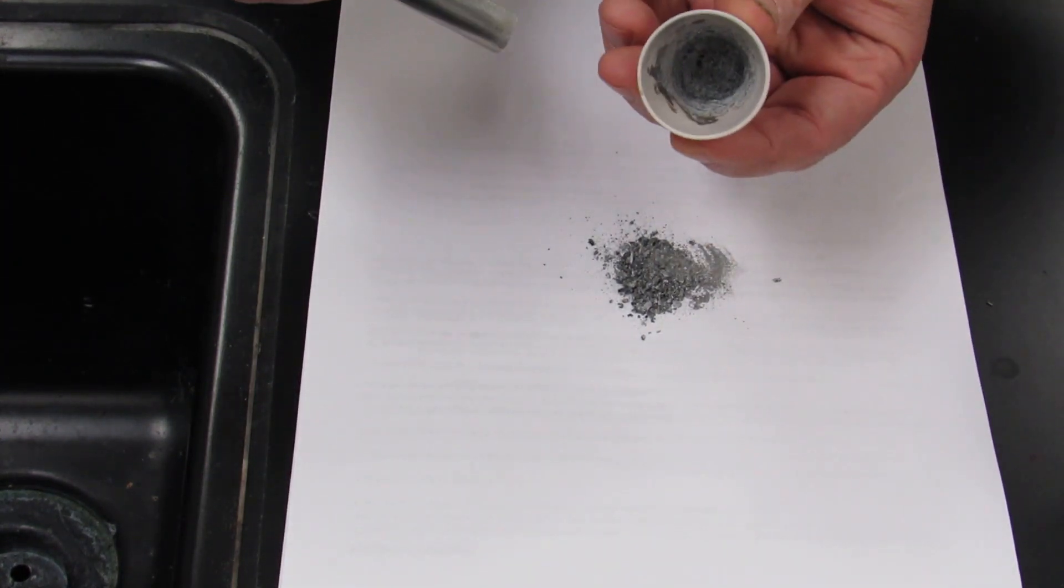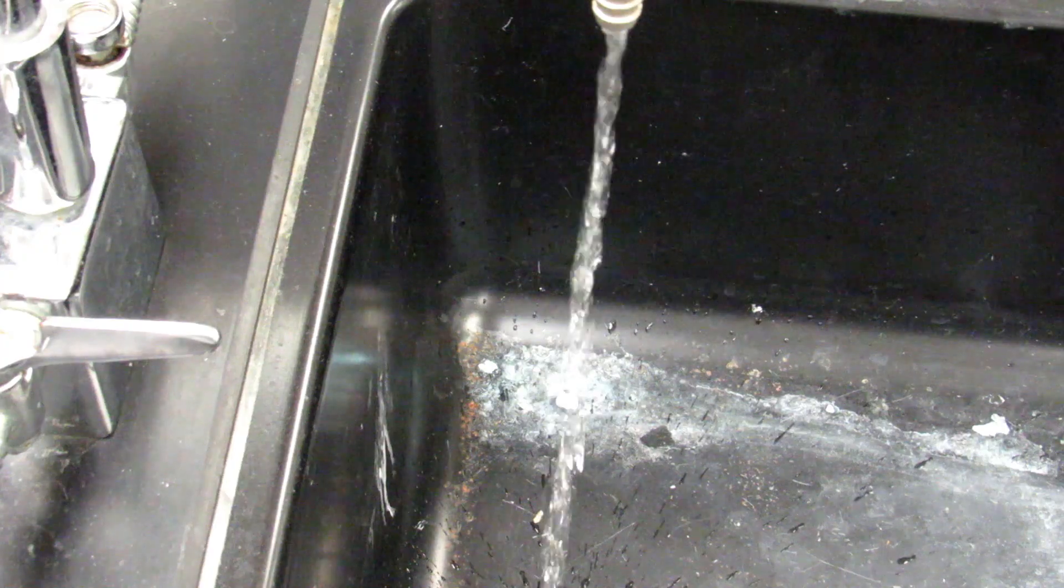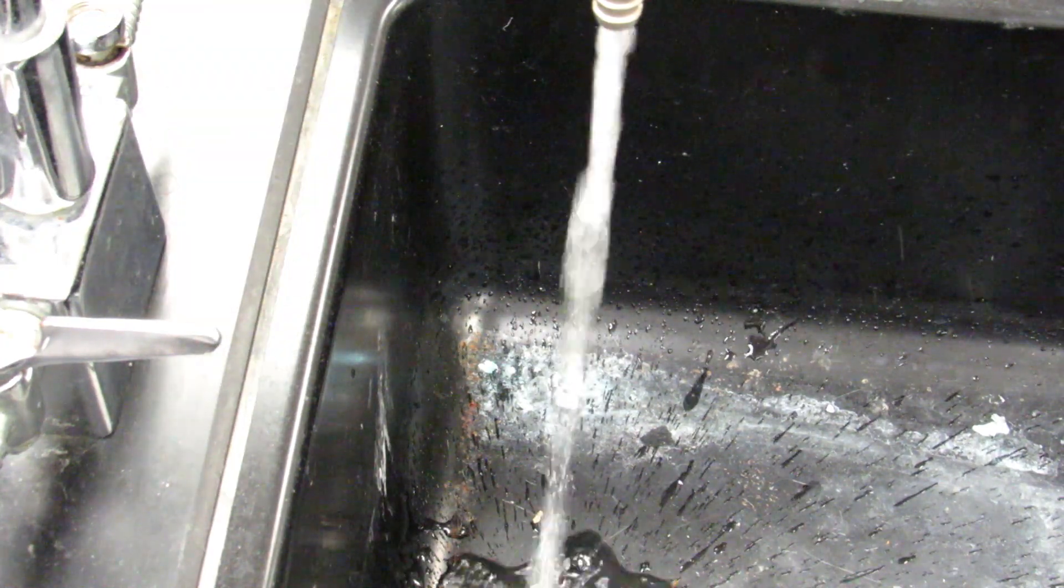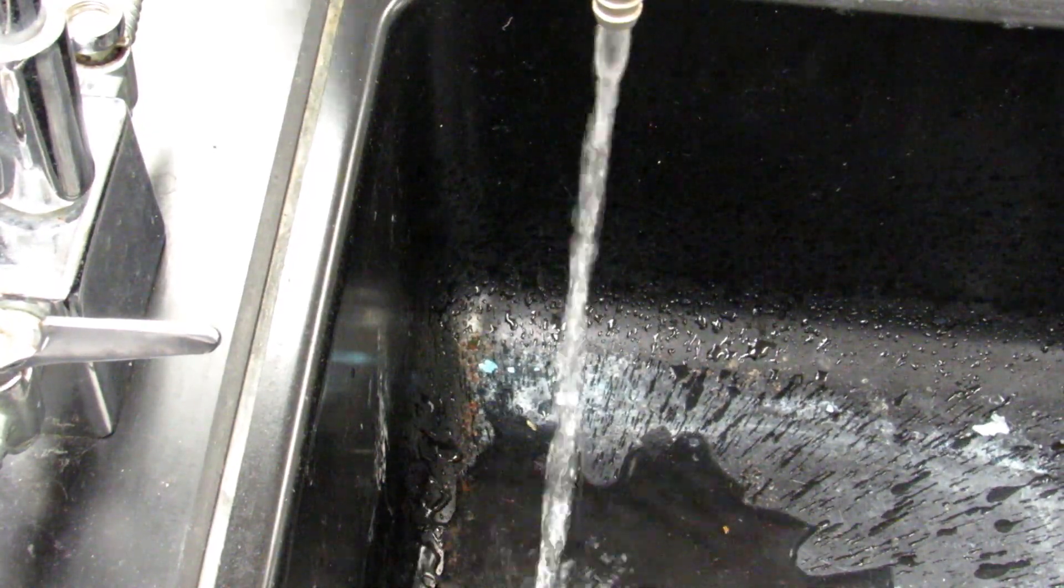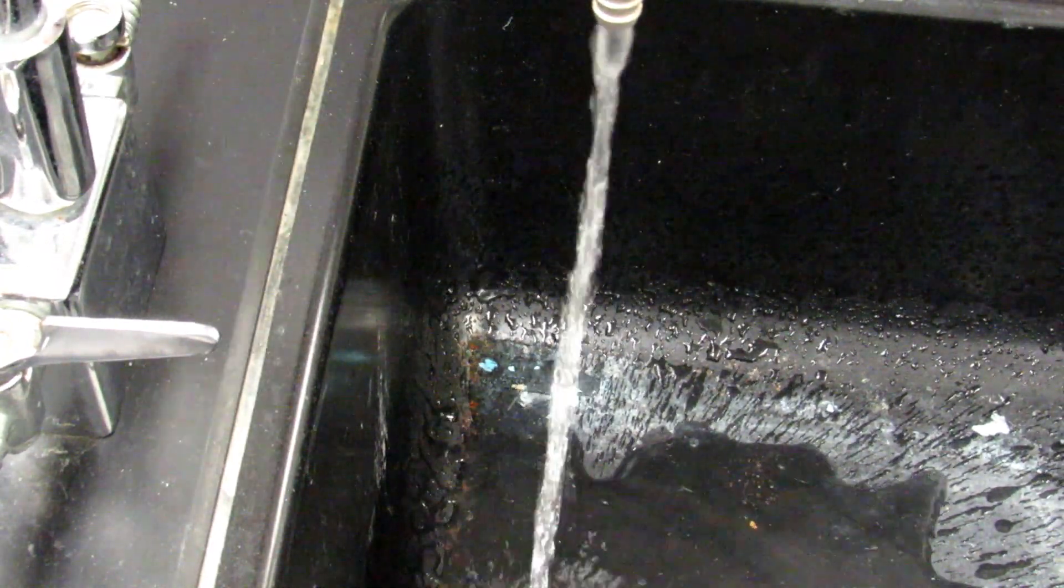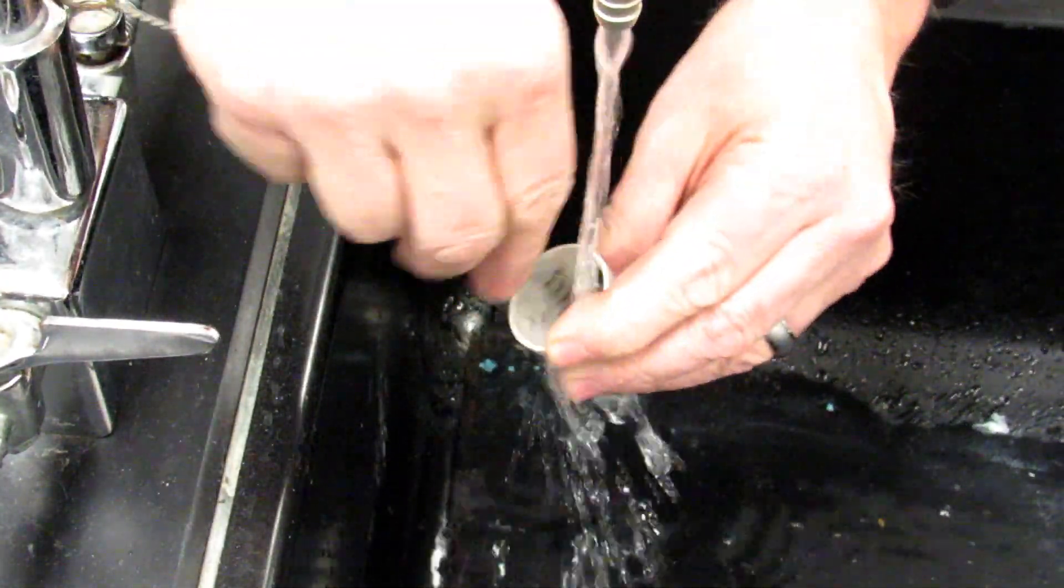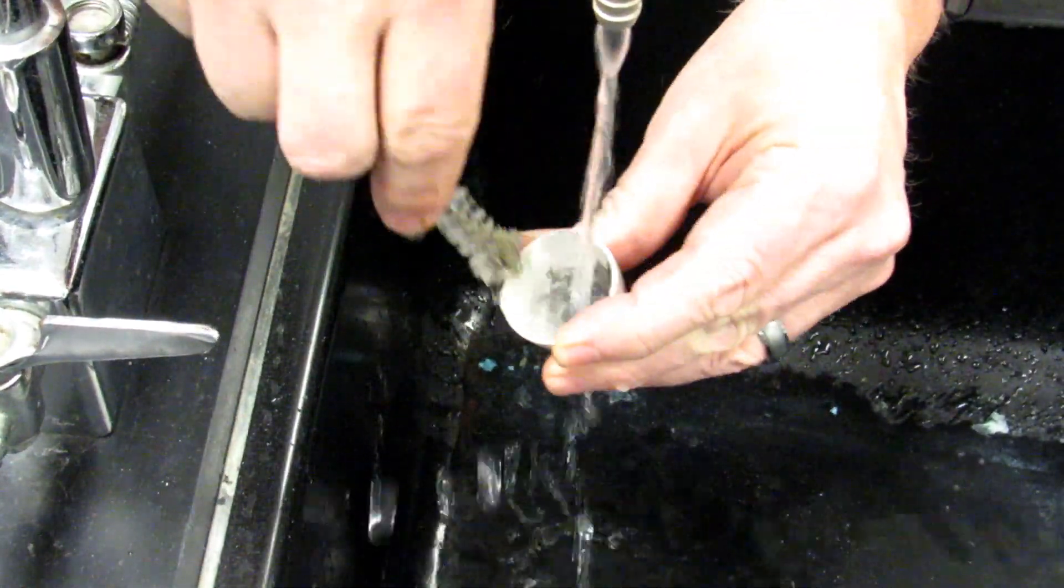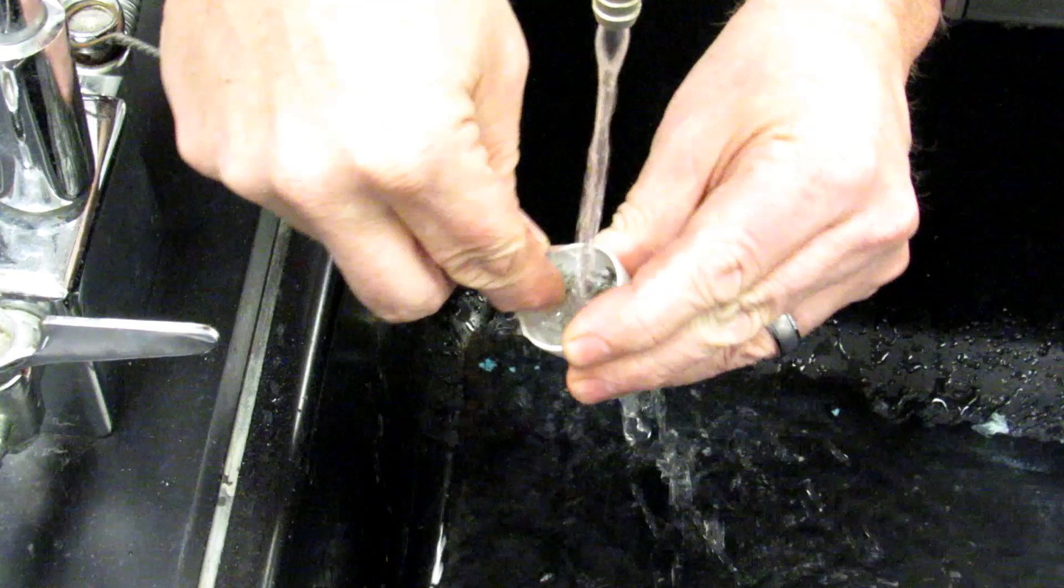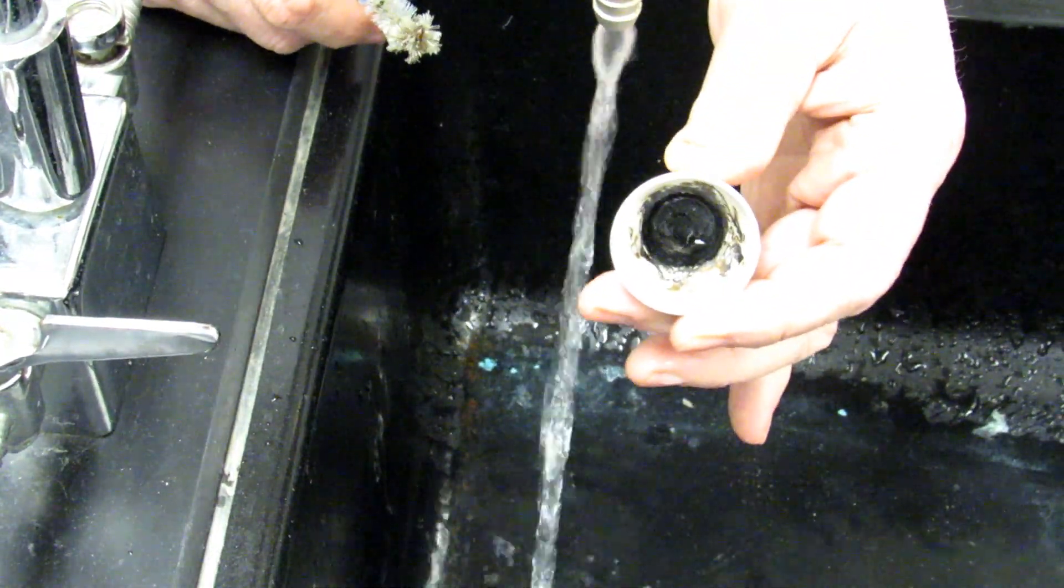Be careful not to break it. Then you're going to take a small brush. You're going to clean out the inside of the crucible. It's not going to go white. It's still going to be a blackish color. Just give it a good scrub to get as much of that magnesium oxide out there as possible. And that's it. Just clean up after that point.